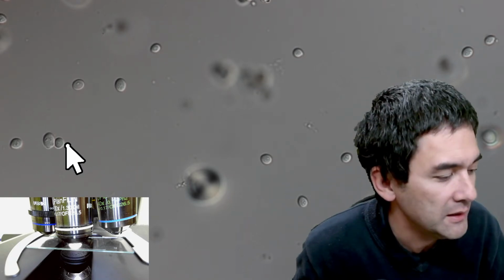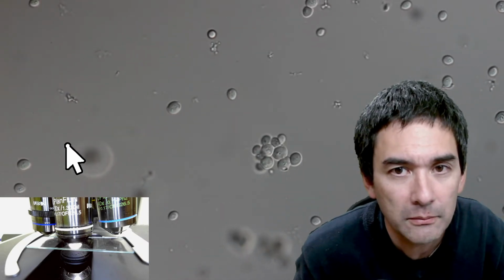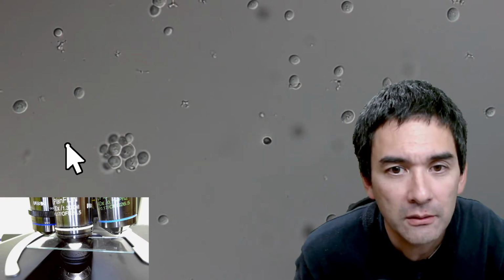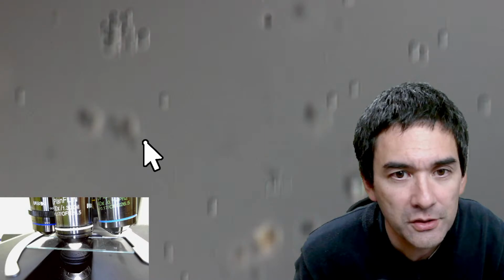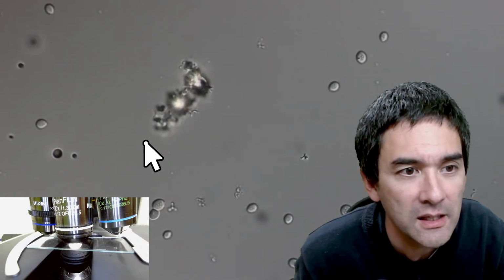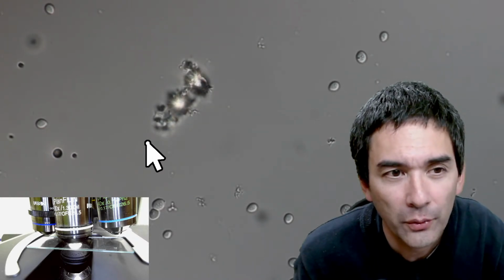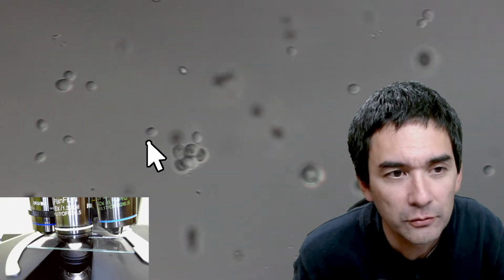So here, these are now the yeast cells at maximum magnification. The yeast cells here are not budding because this was dry yeast, so I'd have to add a little bit of sugar and wait a few hours, and then I might see some yeast cells start to form tiny outgrowths where the cell is dividing, because yeast divides asymmetrically. Still regular mitosis.